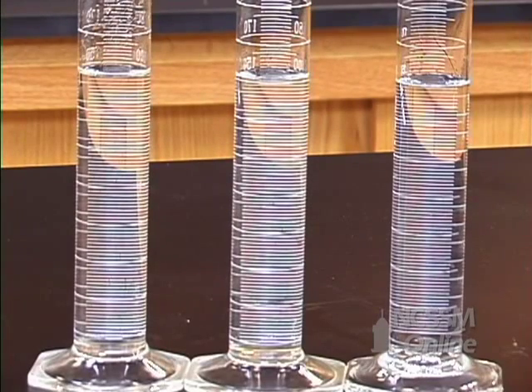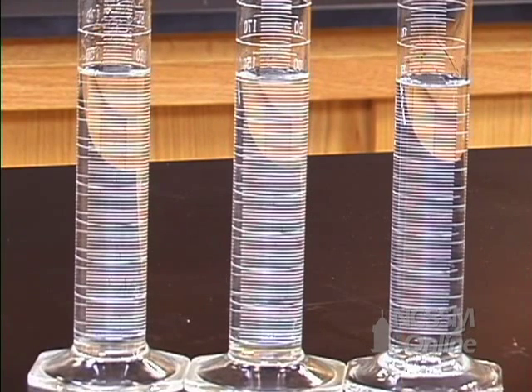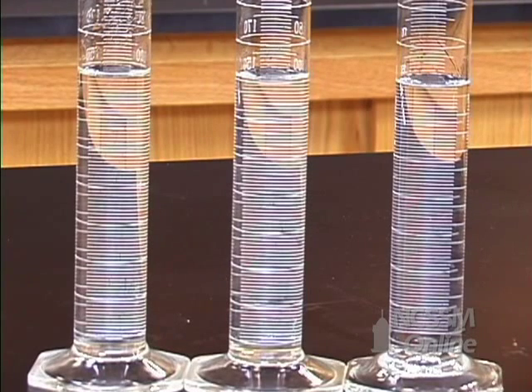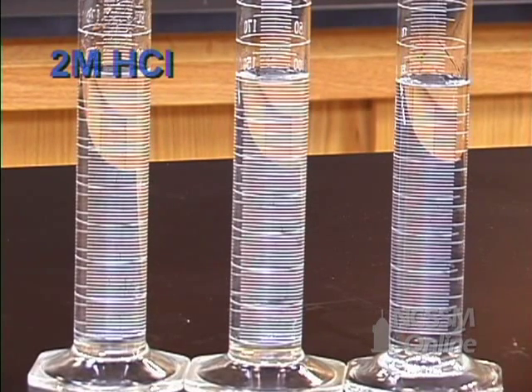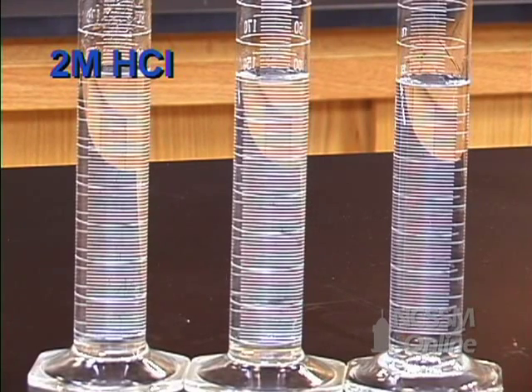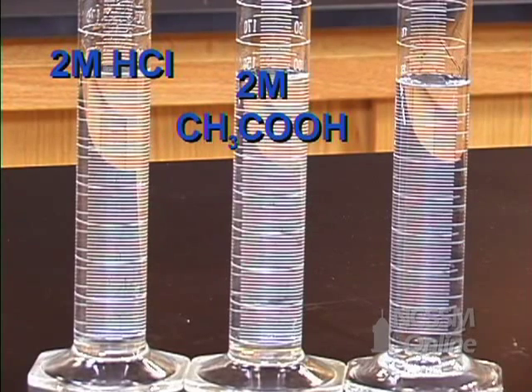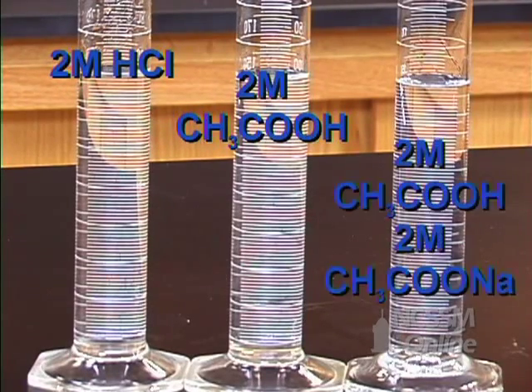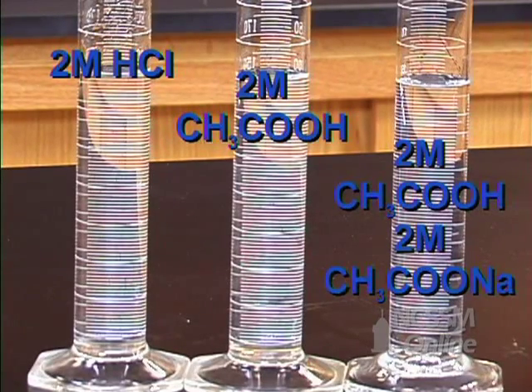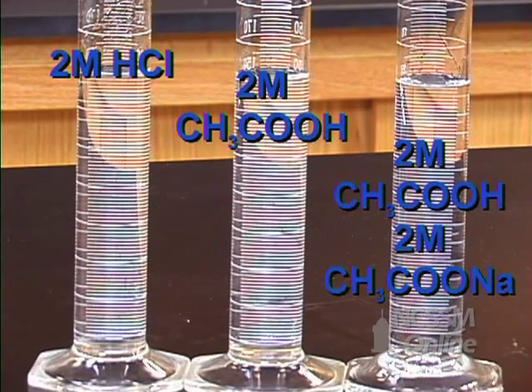We're going to do a demonstration illustrating strong acids, weak acids, and buffers. We have three graduated cylinders. The graduated cylinder on the left contains two molar hydrochloric acid, a strong acid. The graduated cylinder in the center has two molar acetic acid, a weak acid. The graduated cylinder on the right contains a buffer mixture of two molar acetic acid and two molar sodium acetate.